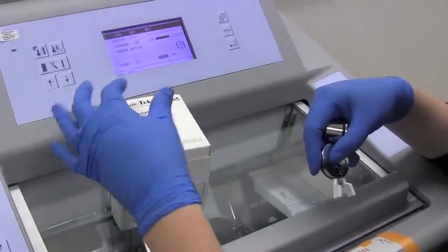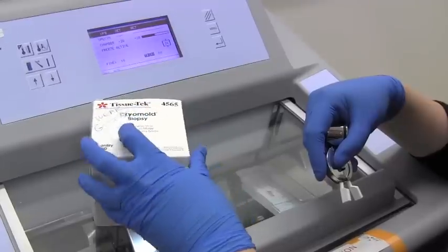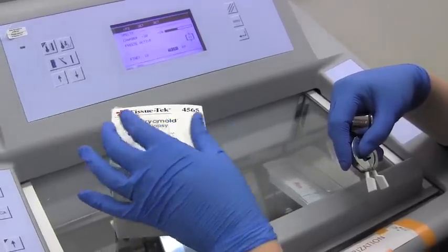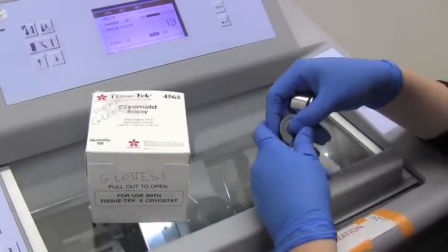Sampling your tissue you can do in your lab on dry ice, so you don't have to do it actually in this room. You can buy a number of different cryo molds that come in different shapes and sizes. We like this one. If you have a bigger stem or something, you could use that.